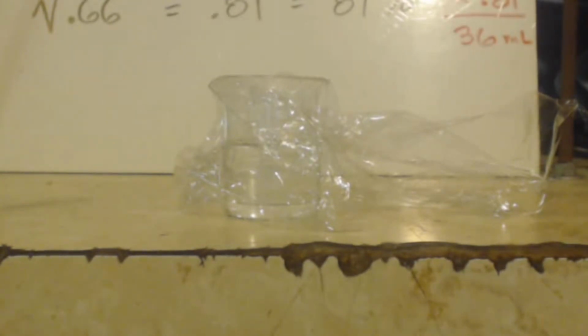Even if I did distill this and lost some of it, I would still do a lot better than I did in the first one. That's a terrible yield, 5% overall. But even if I distilled this and dropped it down to 50% overall instead of a 66, I'd still consider that pretty good, you know, for a beginner especially.